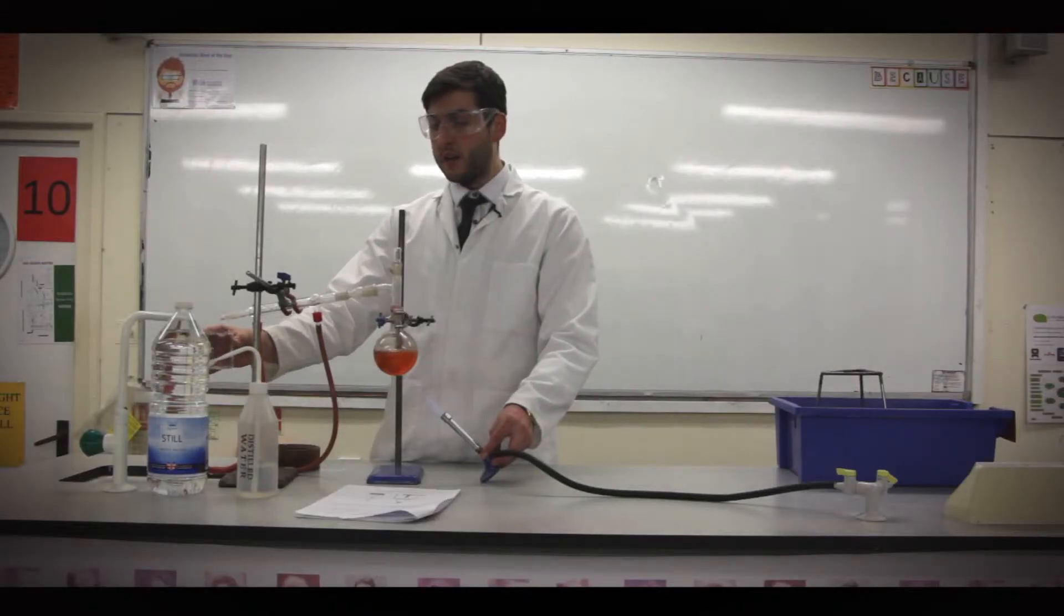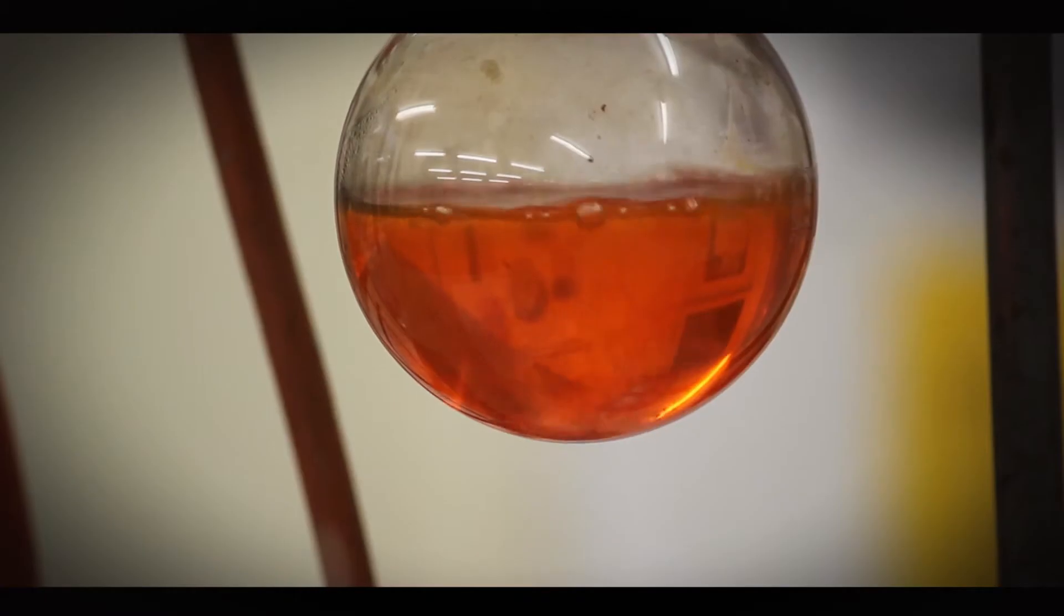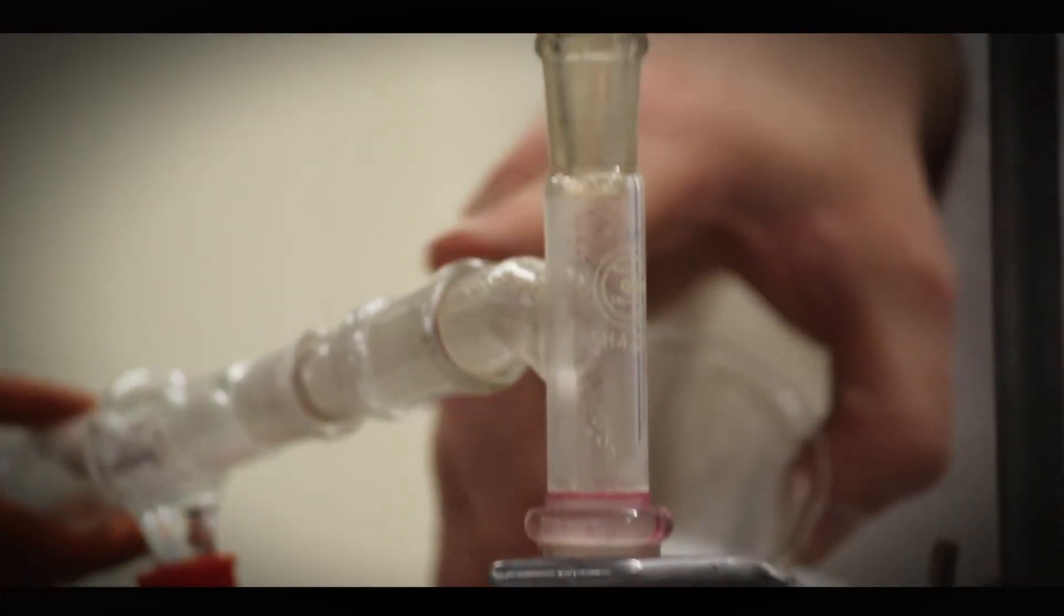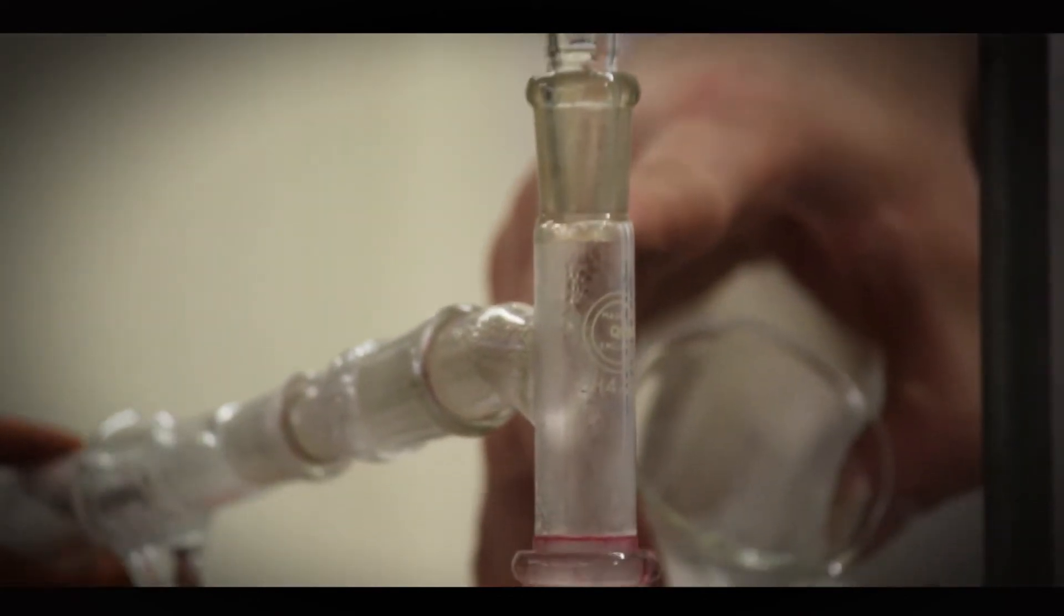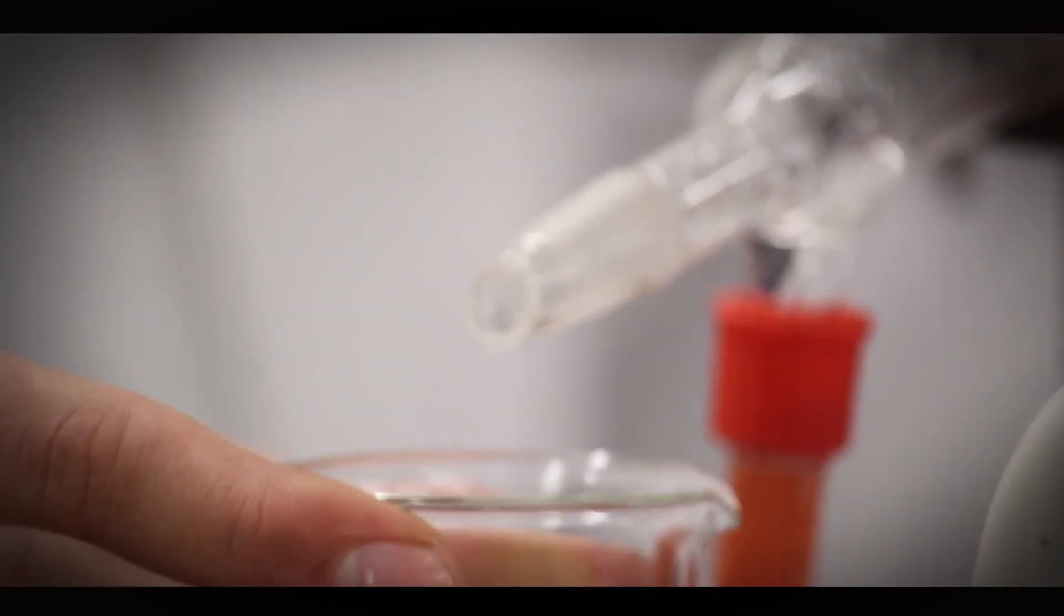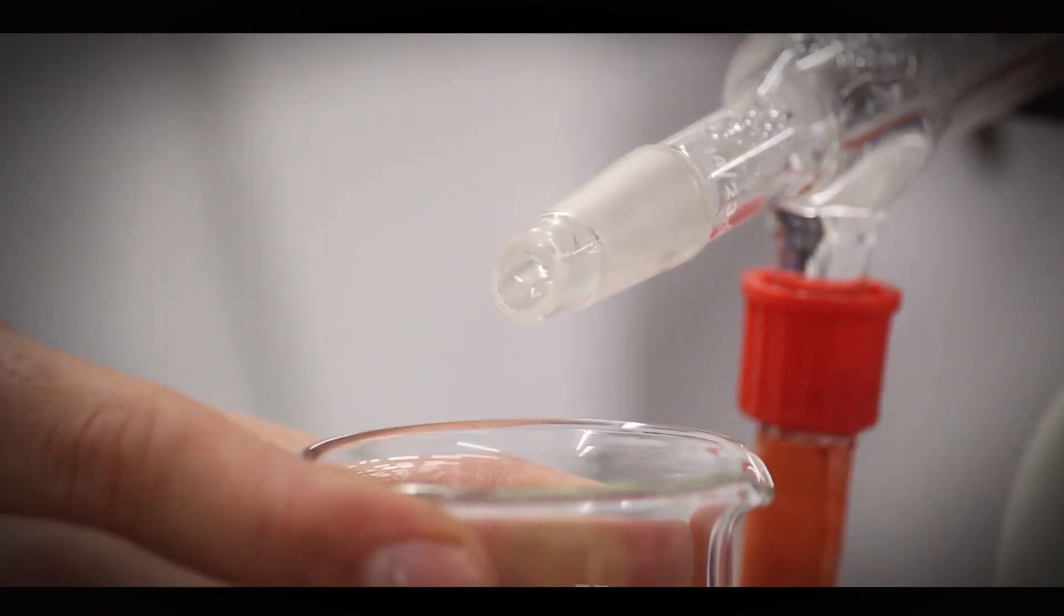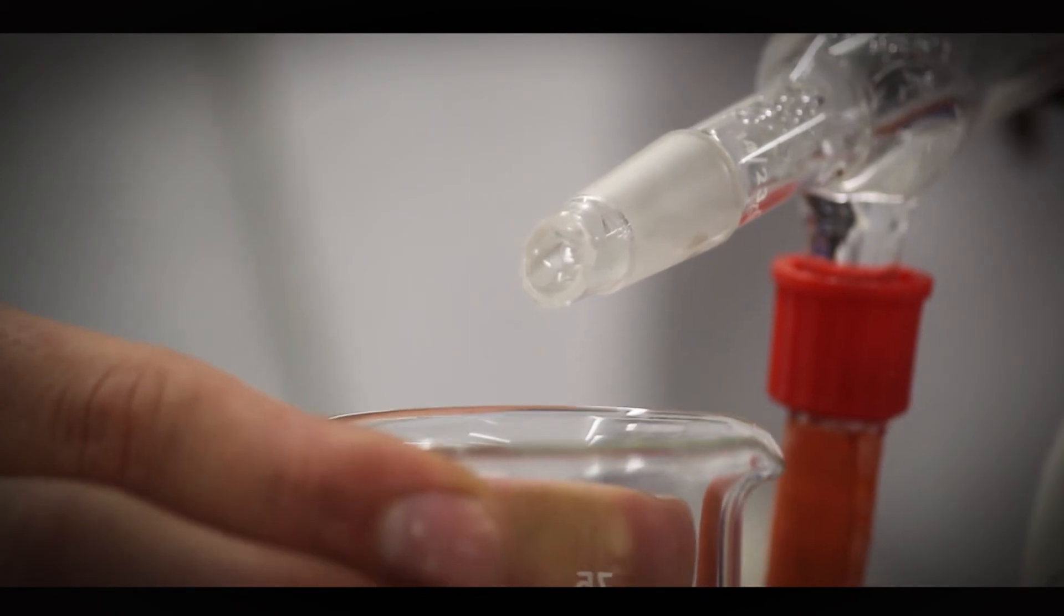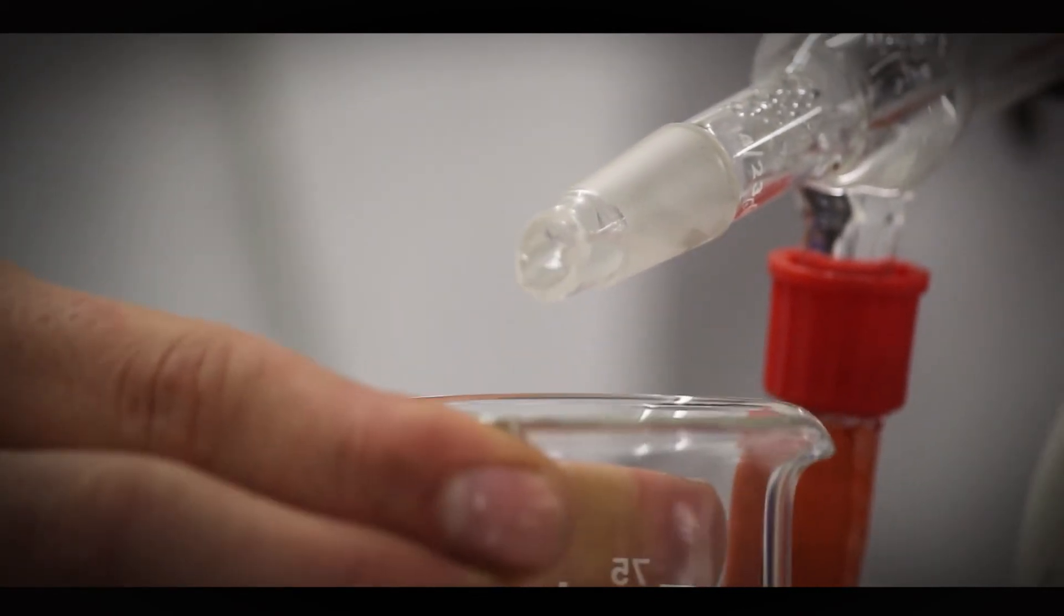So I will hope to see some water come out here. As you can see, the water has started to condense in the Liebig condenser, and it should, here we are, look at this, come out, and it should come out clear.